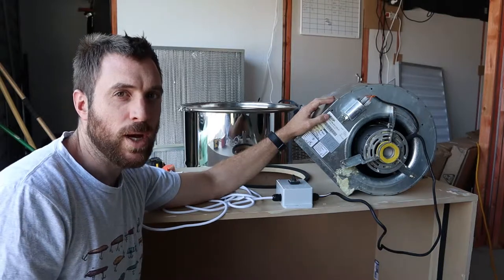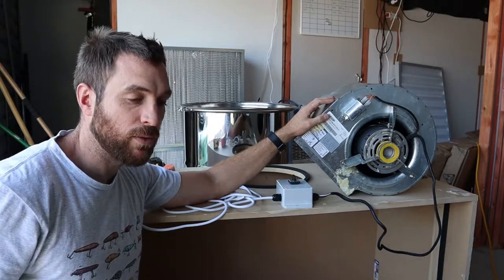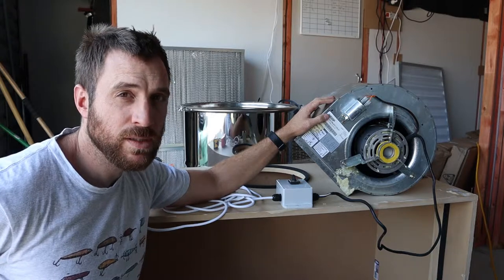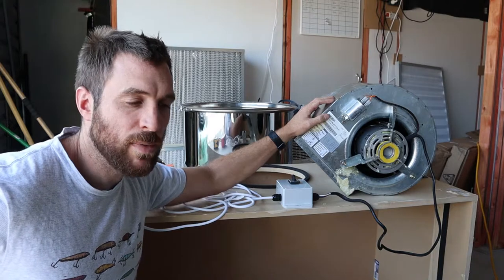Okay, I'll just take you through my fan selection for my homemade laminar flow hood. I made a mistake when I done mine. It's probably a mistake on purpose, I suppose, just because I found it hard to buy the equipment. But yeah, I'll talk to you guys about my mistakes. Hopefully you won't make the same one.